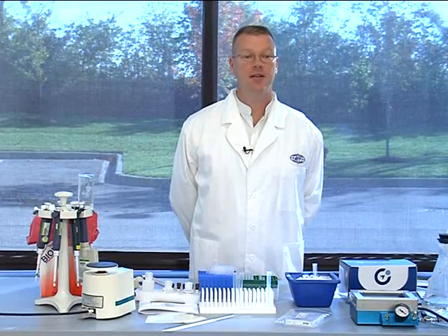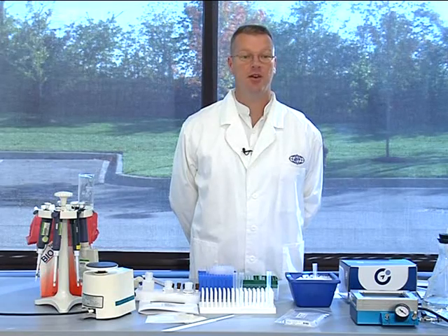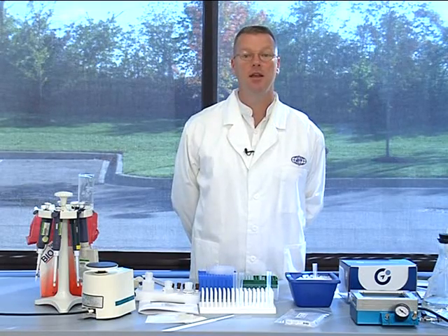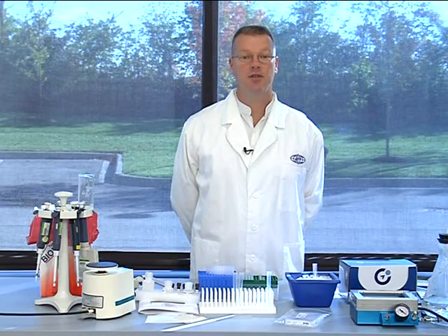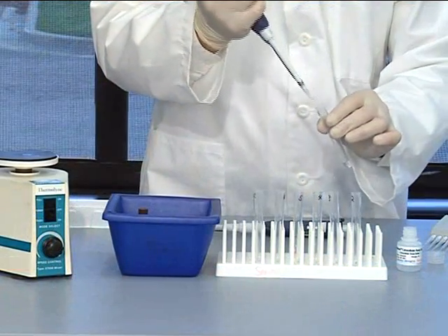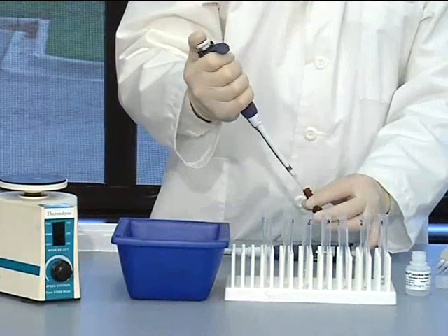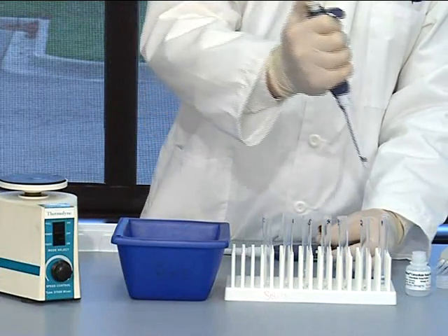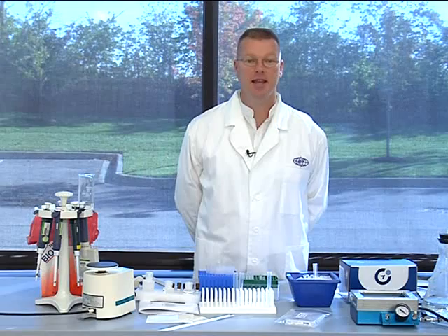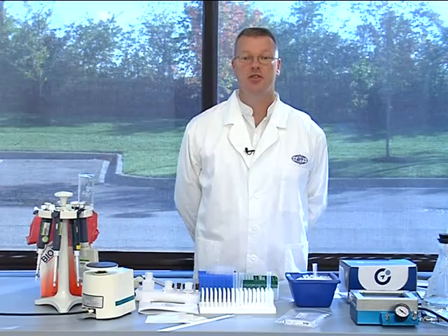Now label seven tubes number one through number seven to correspond to the seven standards that make up your standard curve. Pipet 850 microliters of extracellular assay buffer one into tube number one and 400 microliters of extracellular assay buffer one into the tubes numbered two through seven. Next, add 100 microliters of the reconstituted standard cocktail one and 50 microliters of standard cocktail two to tube number one. Vortex the contents thoroughly. Standard tube number one now contains 10,000 picograms per ml of each cytokine and eicosanoid and will serve as your high standard.